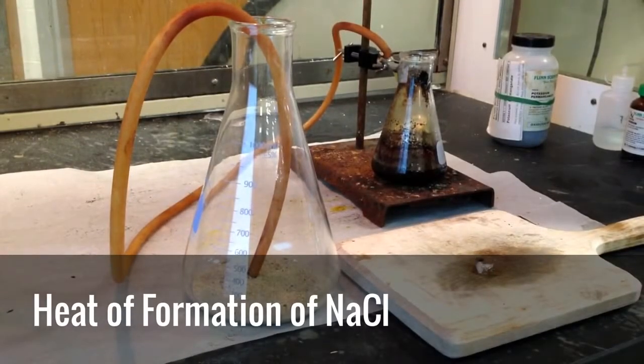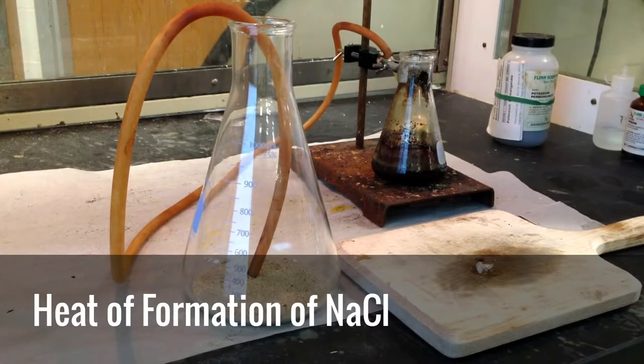In this demonstration, I'm going to attempt to make sodium chloride. A very cool reaction, one of my favorites, as I always like to say.